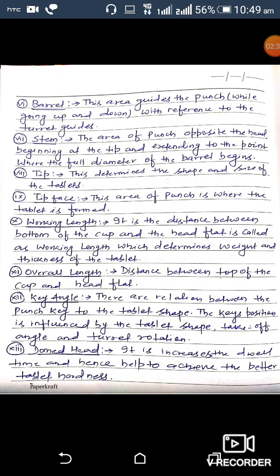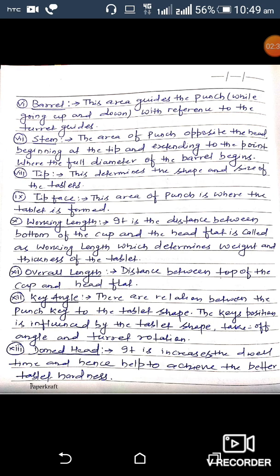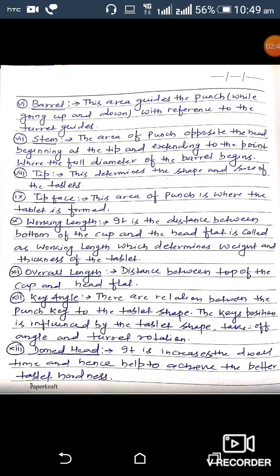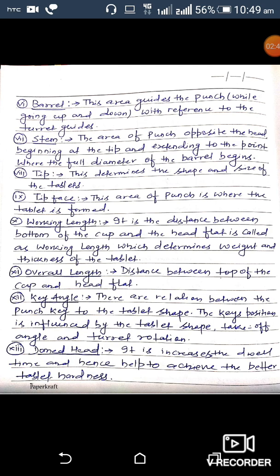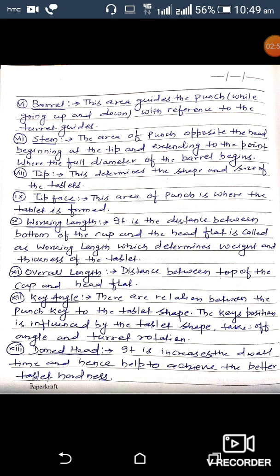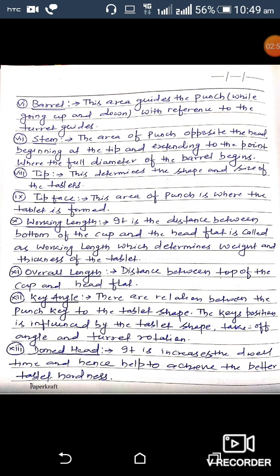Tenth is working length: the distance between the bottom of the cup and the head flat, which determines the weight and thickness of the tablet. Eleventh is overall length: the distance between the top of the cup and the head flat. Twelfth is key angle: the relationship between the punch key and the tablet shape; the key position is influenced by the tablet shape, takeoff angle, and turret rotation.